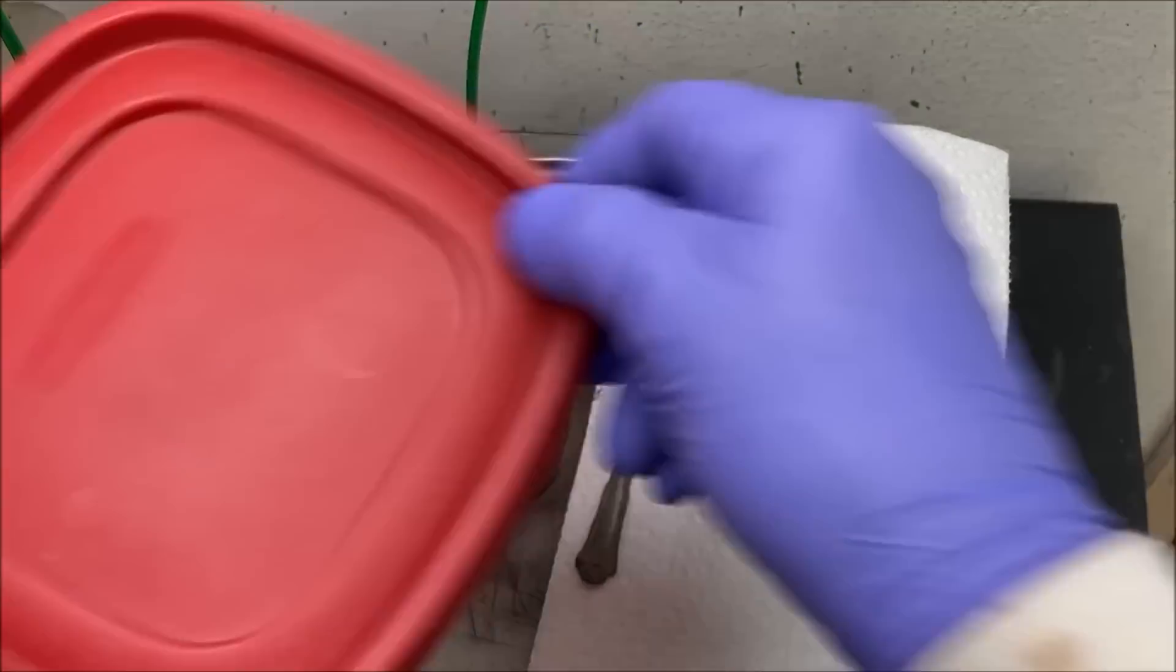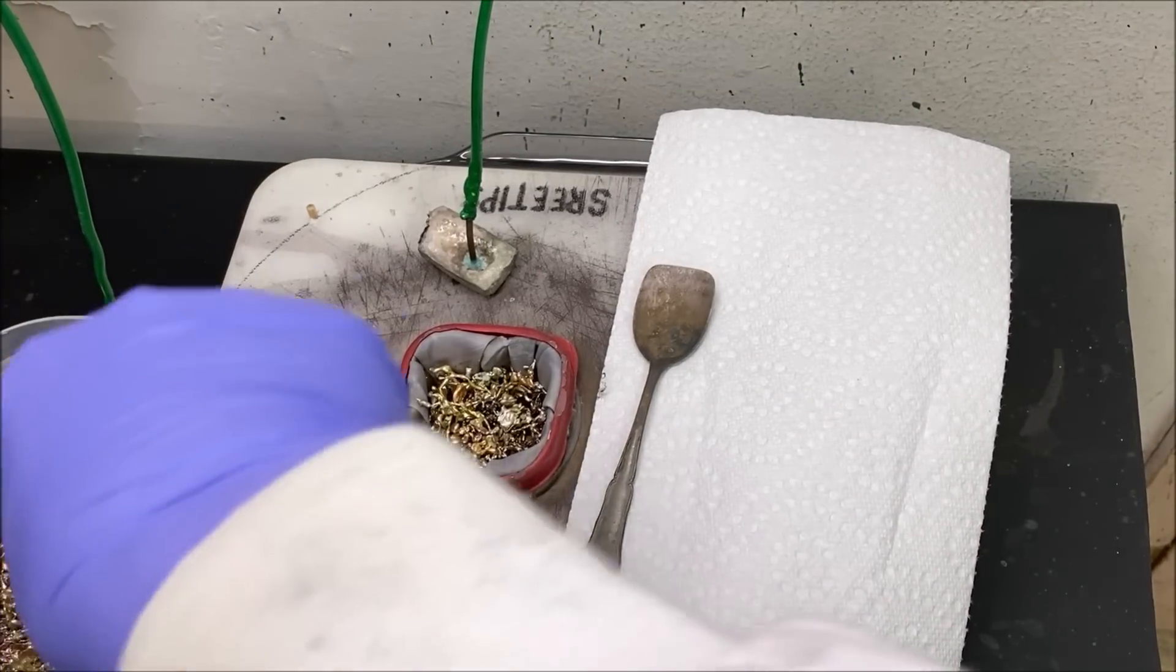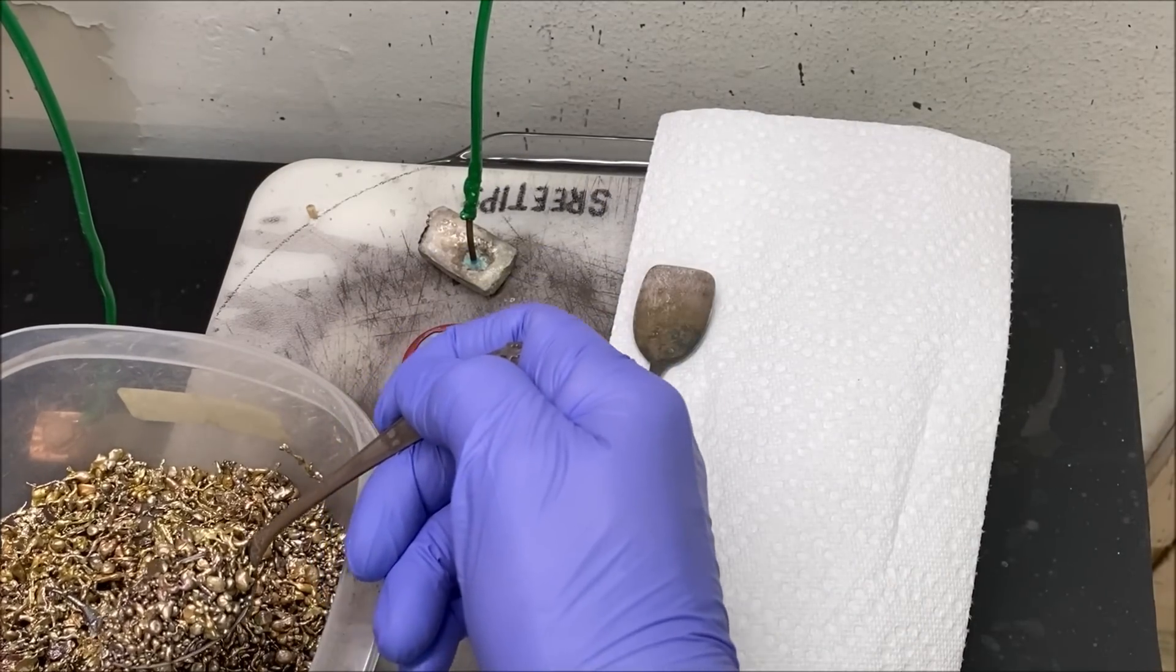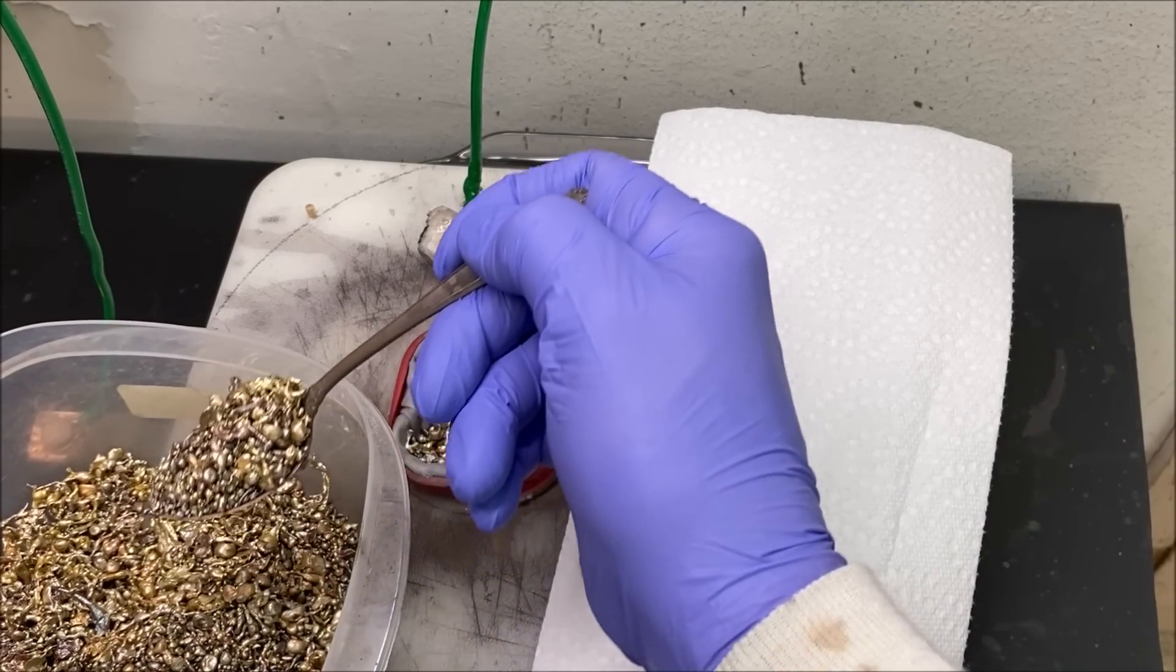We're going to recharge the filter with some more of our impure silver.